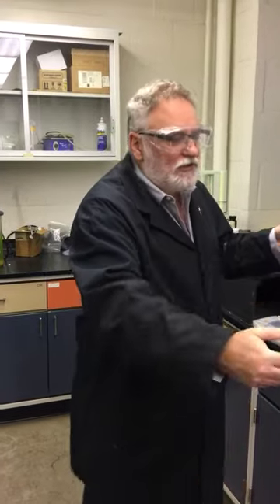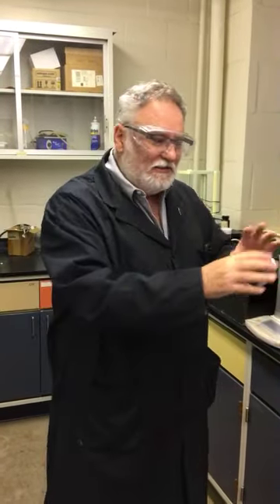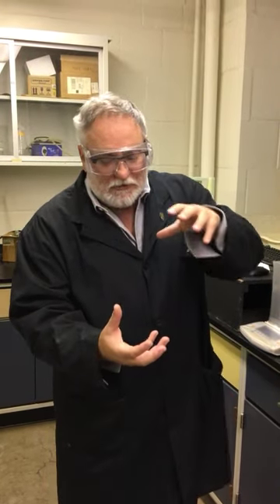The gases coming off initially are going to be different than the gases coming off at the end. The volatiles are different from the combustion products in the chart. And so you can't just do analysis right away. You've got to collect all of that data. A small portion of that, after things have reached equilibrium, we've gone through the oxygen feeding system, maybe multiple different flow rates, again, the detail perhaps. The gases are at equilibrium.